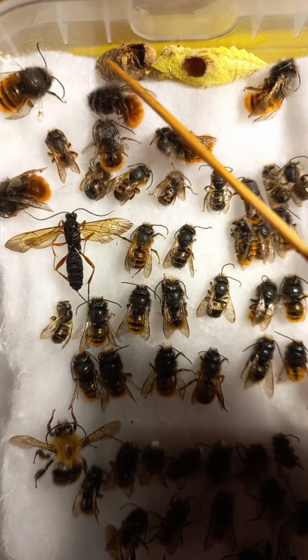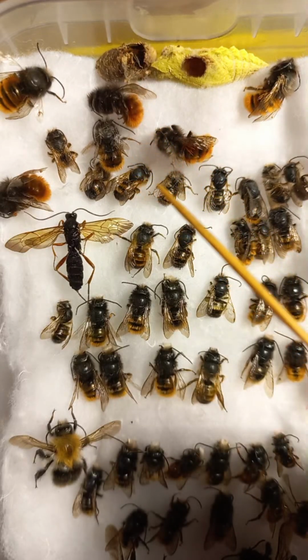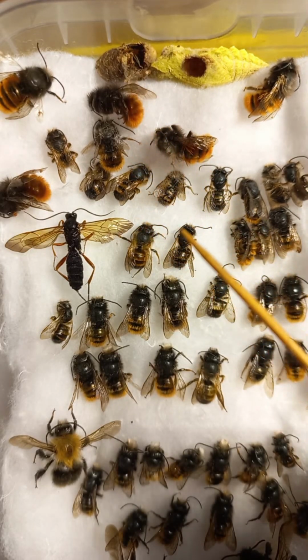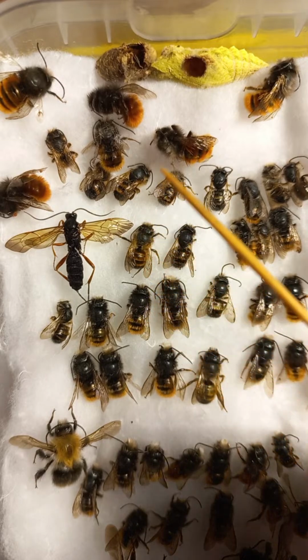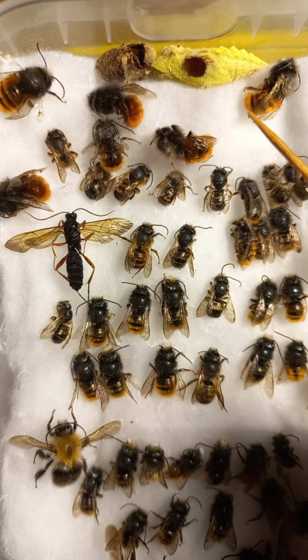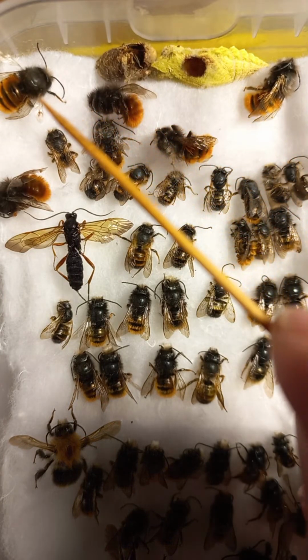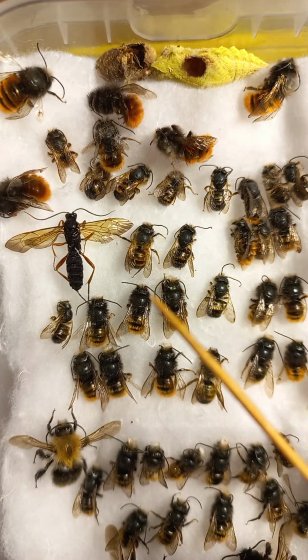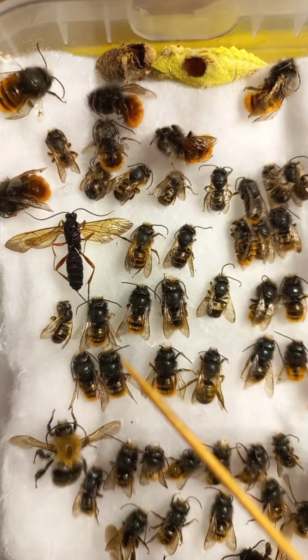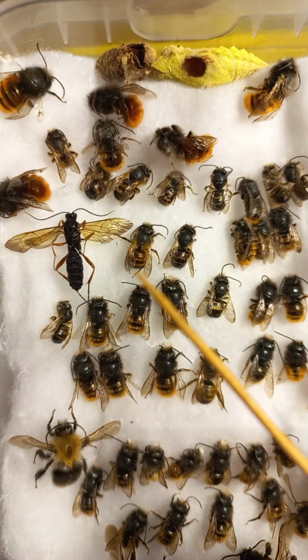This is a cocoon which contains small males of these leafcutter bees. So these are males, and these are females of Osmia, solitary bees. These are females. These are tiny, tiny, tiny males. They can be very tiny, even like that, 2 times smaller than this one.